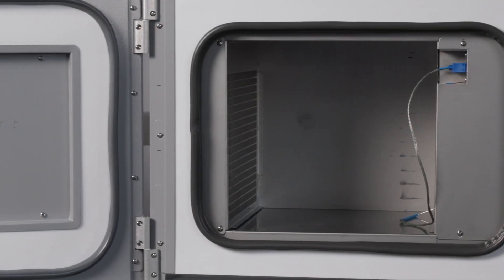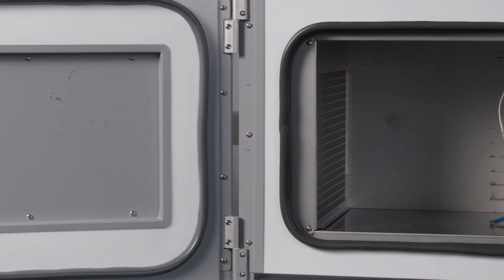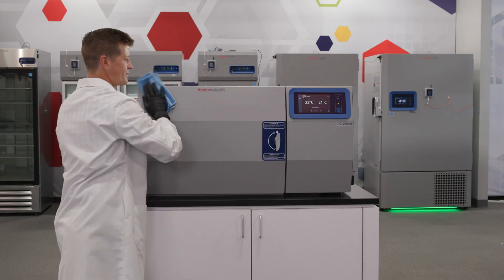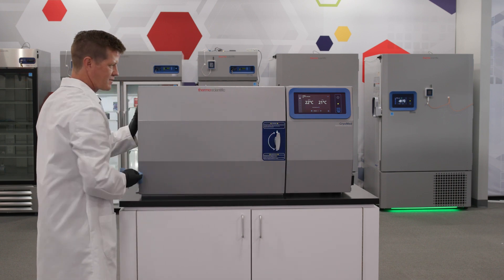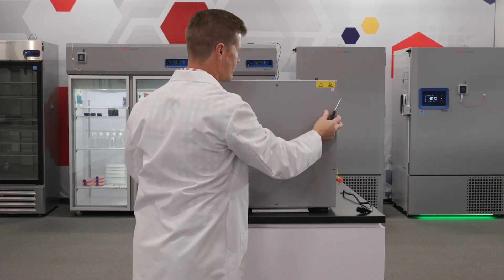Your equipment has been thoroughly tested and calibrated before shipment. Regular preventative maintenance is important to keep your unit functioning properly. The operator should perform routine cleaning and maintenance on a regular basis.